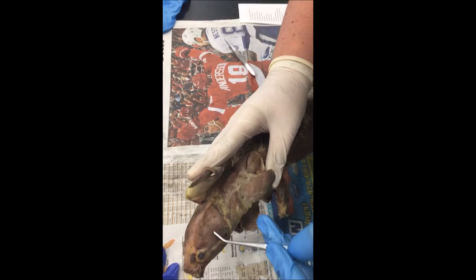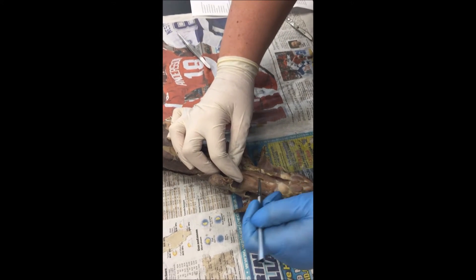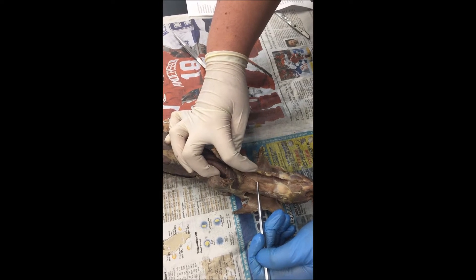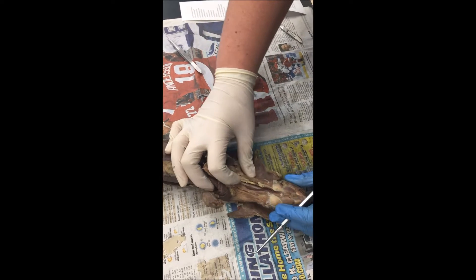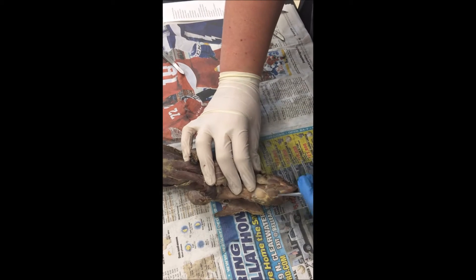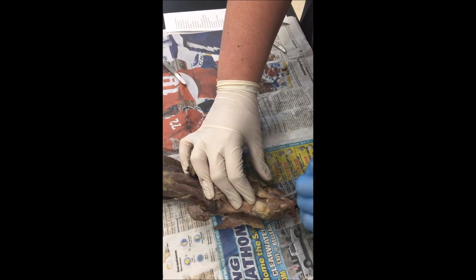This is the temporalis. Sternomastoid are these. The longissimus colli is on the left; on the right is the sternothyroid. This is the trachea, submandibular gland, digastrics, mylohyoid. Underneath, genioglossus is on the sides, geniohyoid is in the middle.